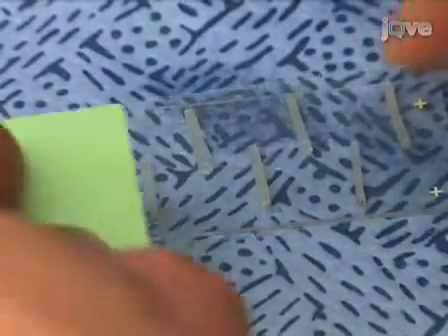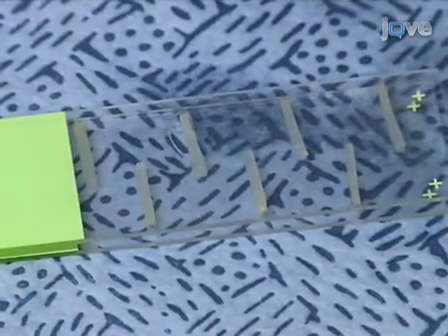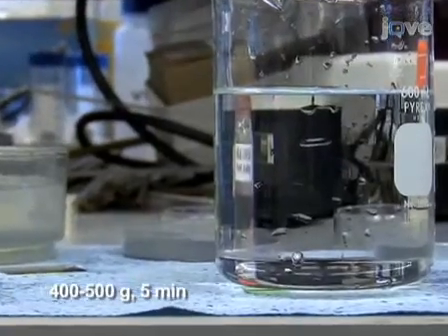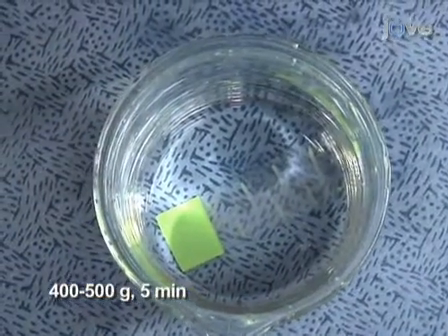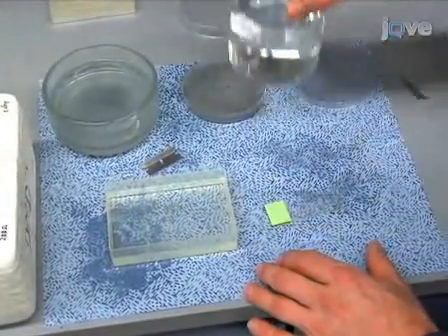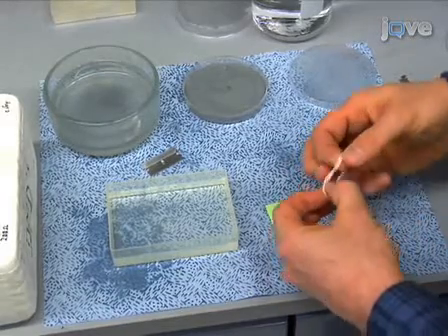After alignment, a second glass slide is placed on top of the group of 8 to 10 samples and a weight, 400 to 500 grams, is placed on top of the glass slide for 5 minutes. We typically use a beaker filled with a suitable amount of water. The weight of the beaker will flatten the cell walls to remove cell sap and to facilitate clamping. Depending on the experiment, the hypocotyls may be inactivated with a brief heat treatment at this point.